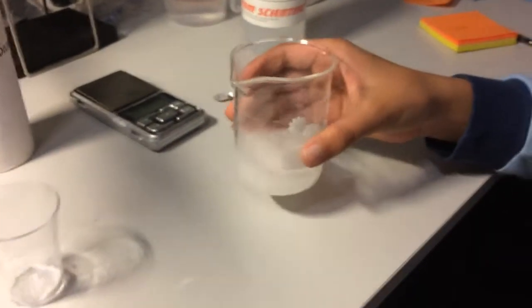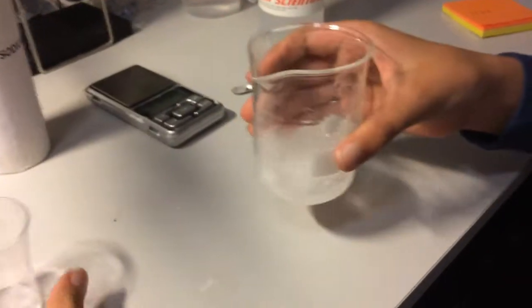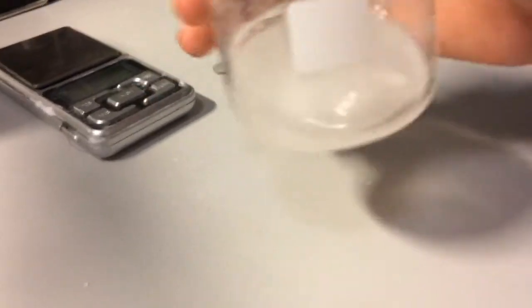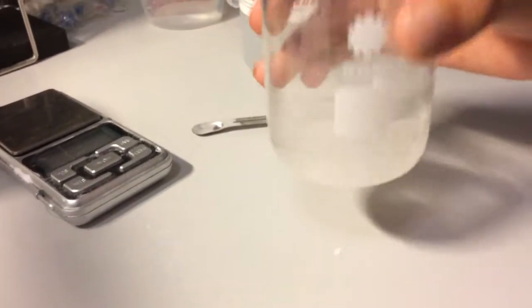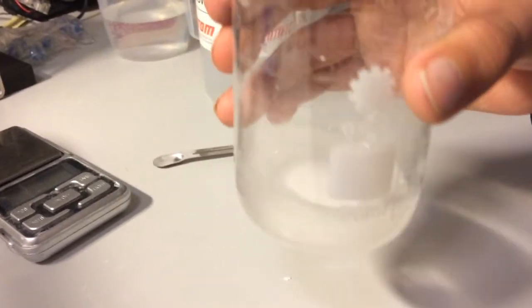As you can see the reaction has caused bubbles and soon we'll measure to see what the weight is.